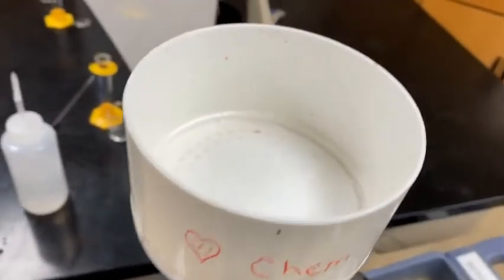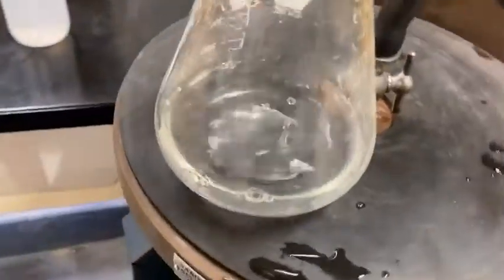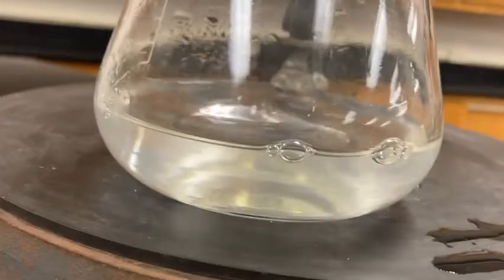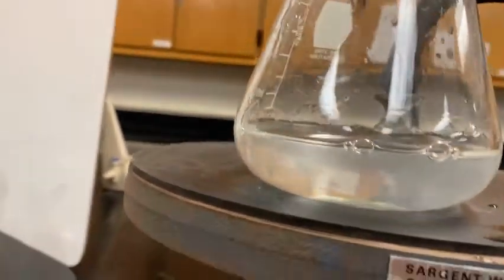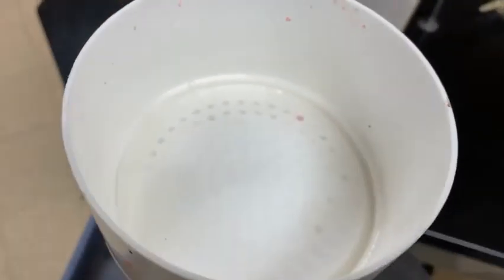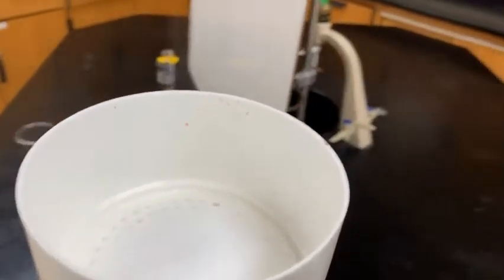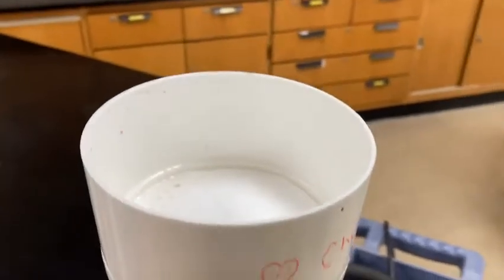And now what I'm going to do is let the vacuum suck some of the liquid out the bottom. And notice my filtrate is pretty darn clear. Not bad. A little bit of a tinge of cloudiness, so not a lot of precipitate got through. Not a bad filtration. I'll turn off the vacuum, and we'll move the top of the Buchner funnel into the oven.